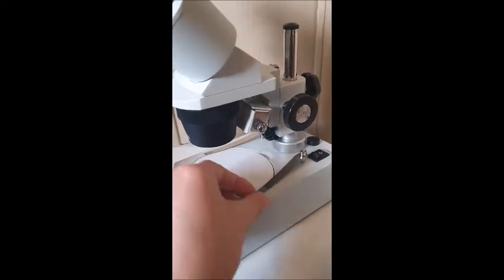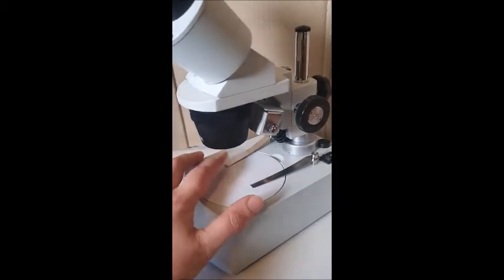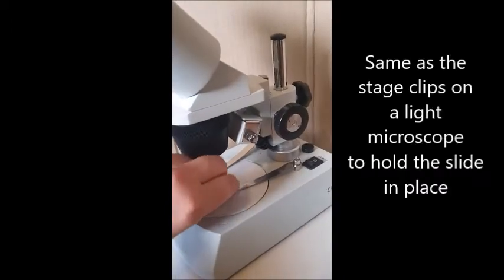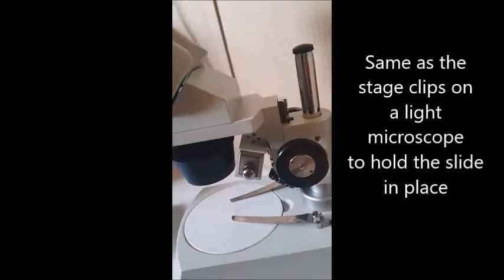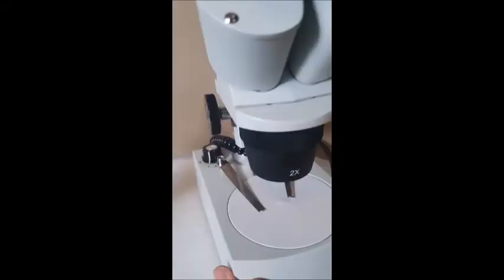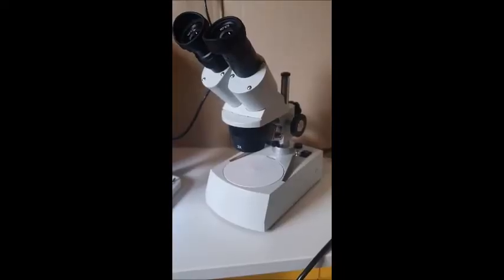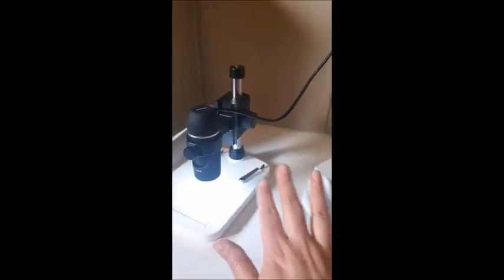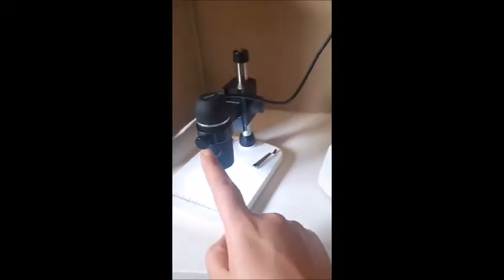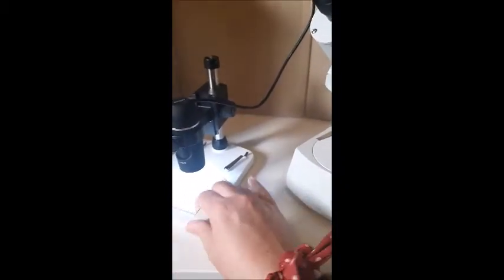These could be called stage clips. These basically hold your specimen in place so it doesn't move. So you can just lift them over the top of whatever you're looking at. And yeah, coarse focus. I think that's all really on this one. These are really great for looking at objects that you can't shine light through. And I've got here next to me a digital version of this. So this is basically the same in that it looks at solid objects.